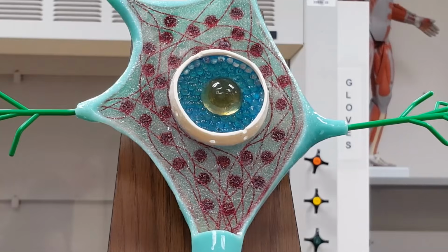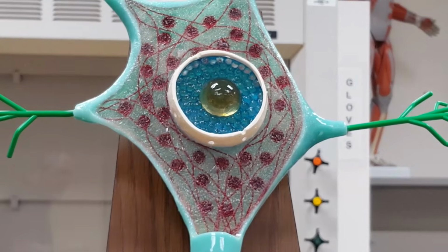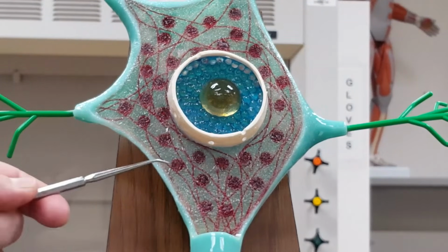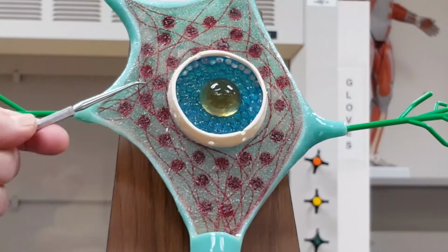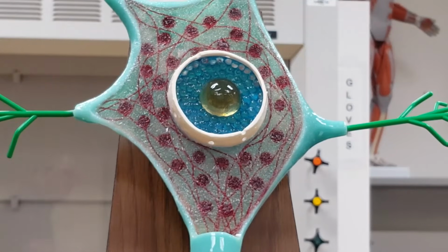Now, I only say this to you people because, think back to my earlier gag, you have a lot of brains, but these cells have a huge amount of endoplasmic reticulum with what amounts to very large ribosomes on them. Look at all these little red, they look like little beads or spheres here. These things are Nissl bodies involved with the manufacture of proteins because these cells make huge numbers of proteins, aka neurotransmitters. Not that I want to get all lectury on you here.